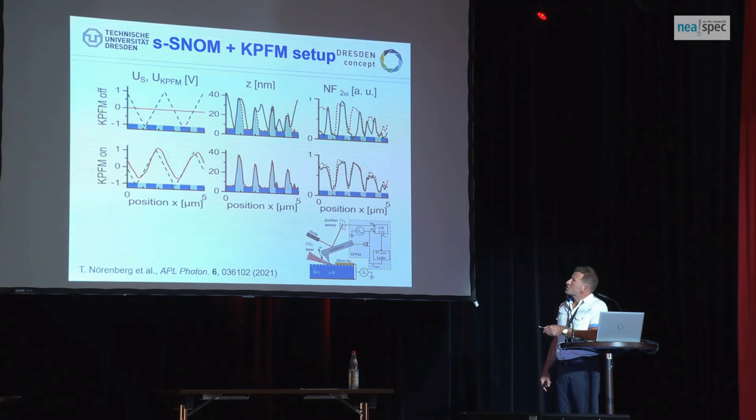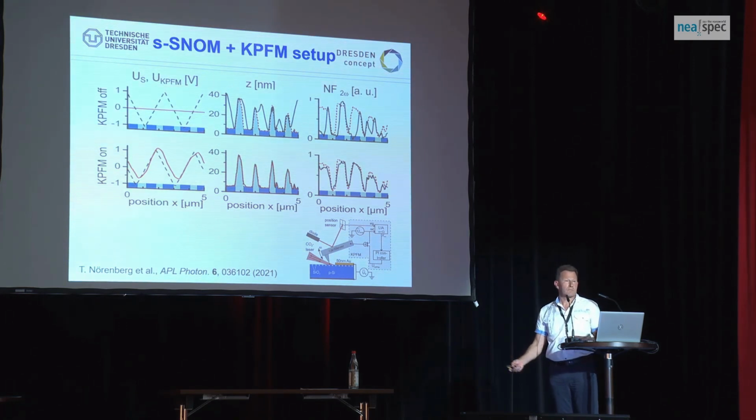First of all, we have switched off the regulator. You see the red line. This is the control KPFM voltage, 0, which means everything of that is added to the topography. You see these quasi errors we get here, and also in the near field signals. The dashed red line is the correct one, while the black one is the measured one. So we see deviations. Generally, you don't see that because you never know how much that is.